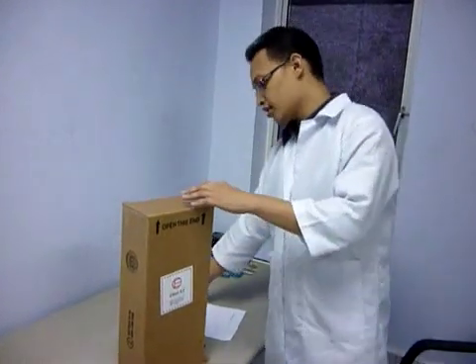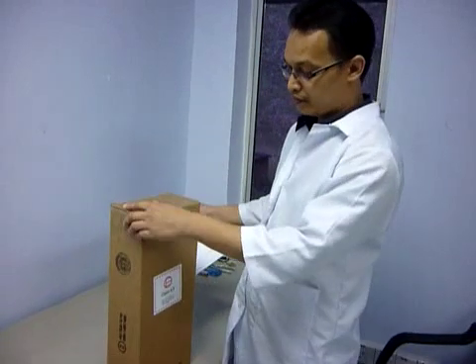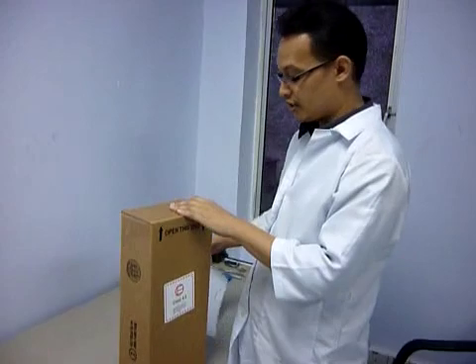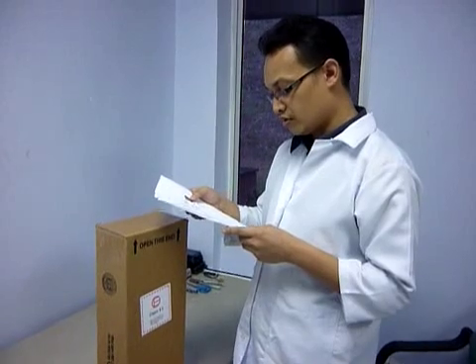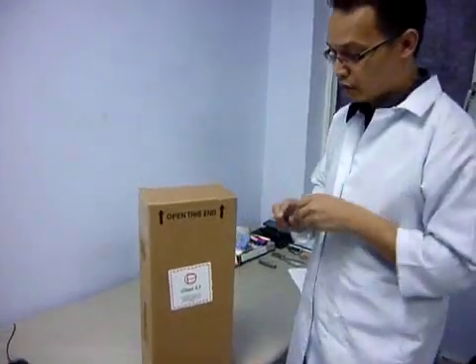This is actually a renewable purifier cartridge or filter that we just purchased from Agilent. The part number is G34406003.